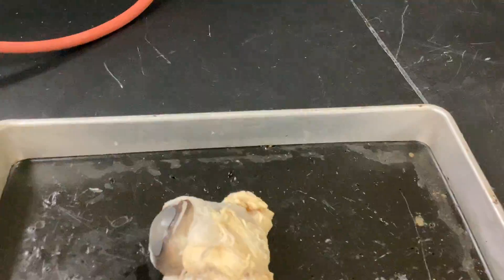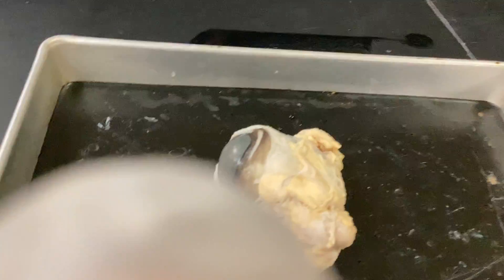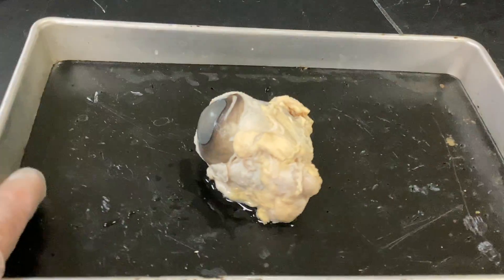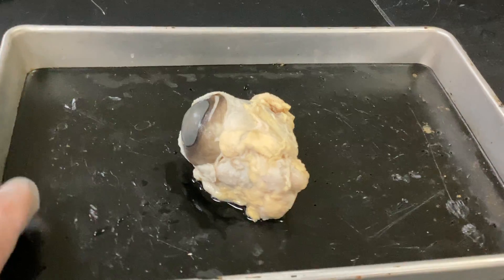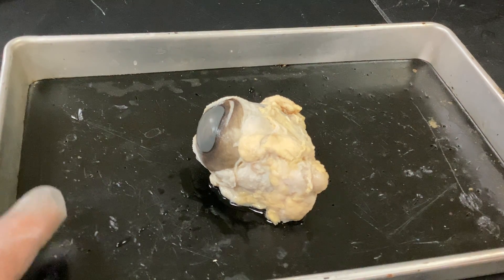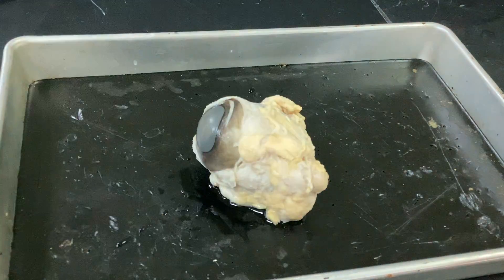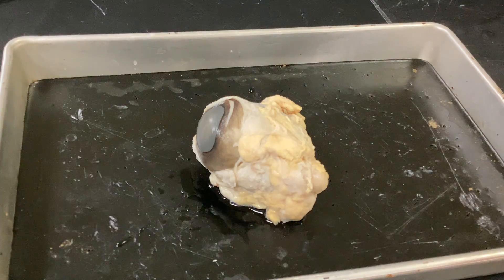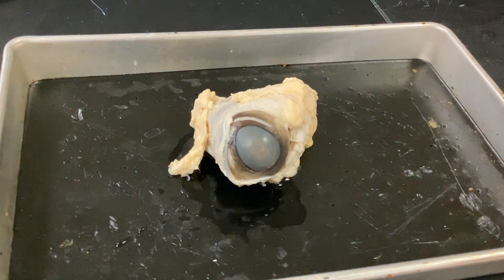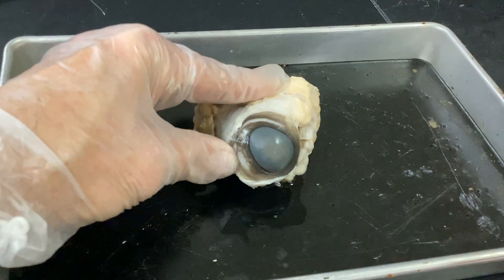Dr. Phil here again. I'm going to go through the eye dissection relatively quickly, but with that caveat I have to cut all of those muscles out. So that's the cow eye.